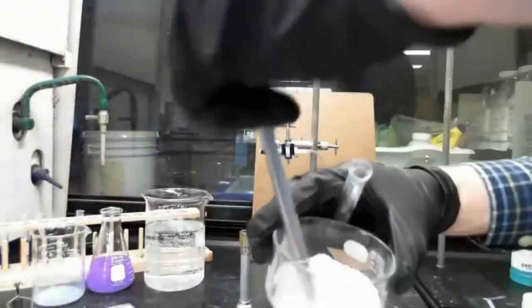We need to do the same thing. I'm going to take our mixture and add it.